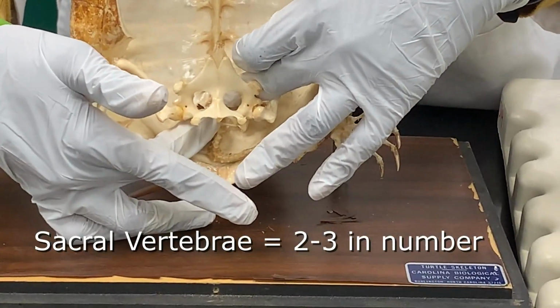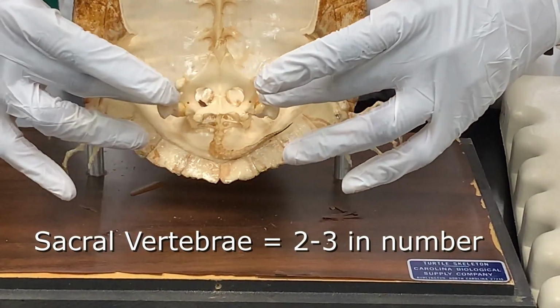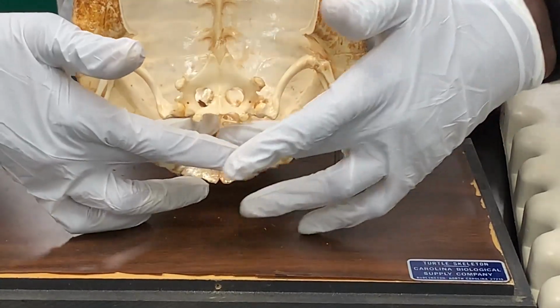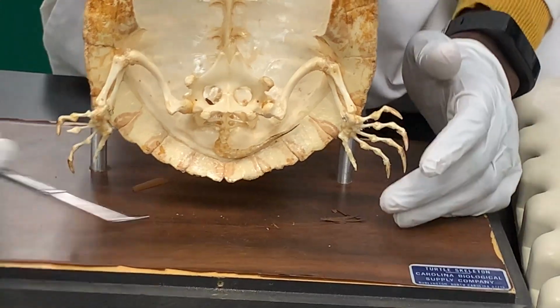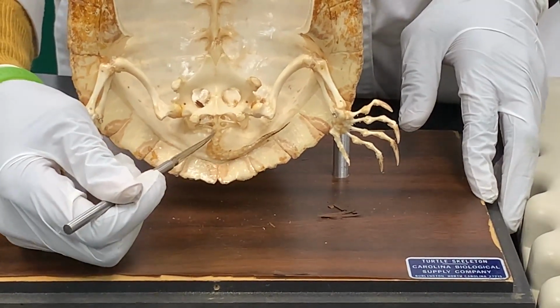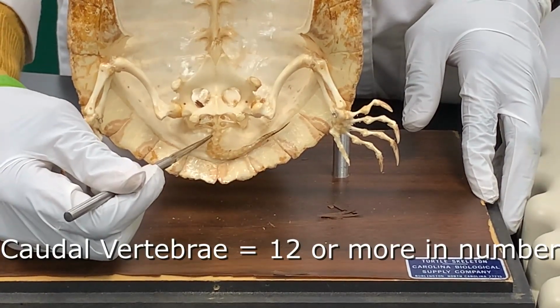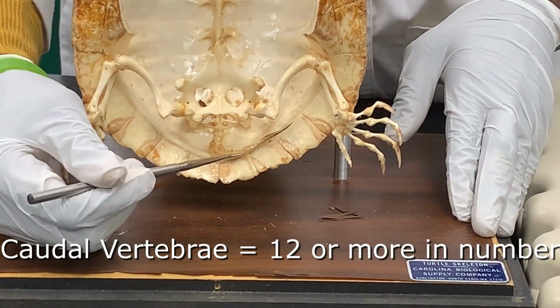We have 2 to 3 in number, and the pelvic girdle is attached to them. Then you have the tail end, and the bony structure that forms the tail is the caudal vertebrae. It's about 12 or more in number.